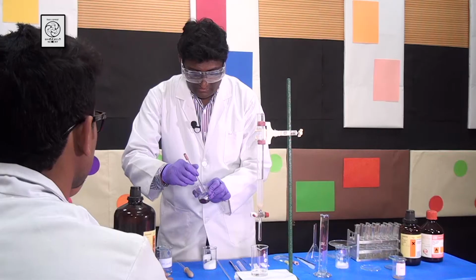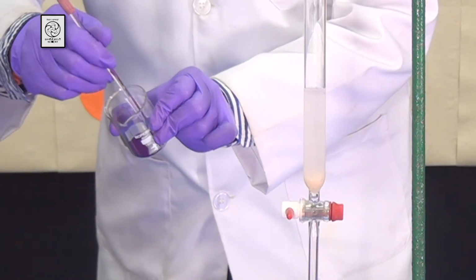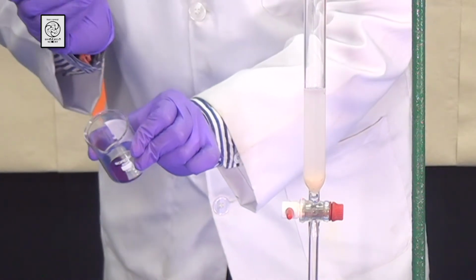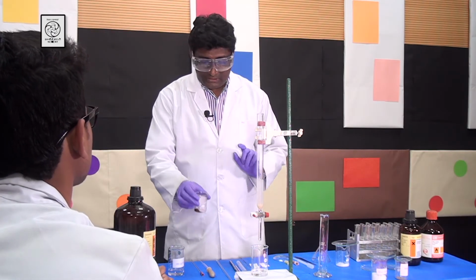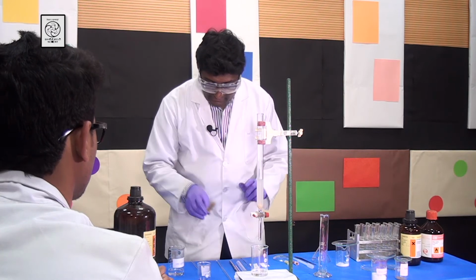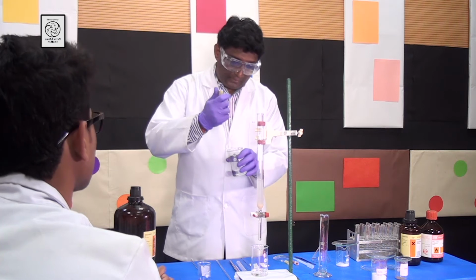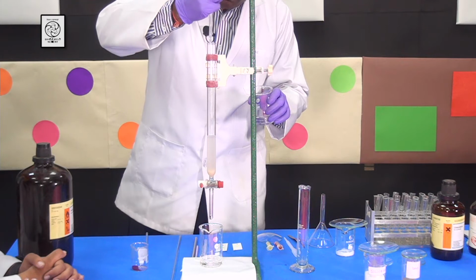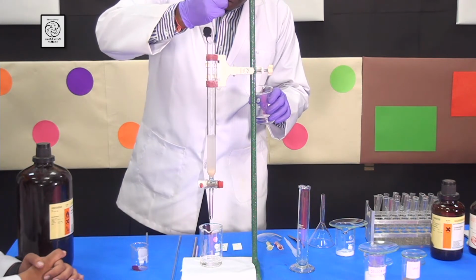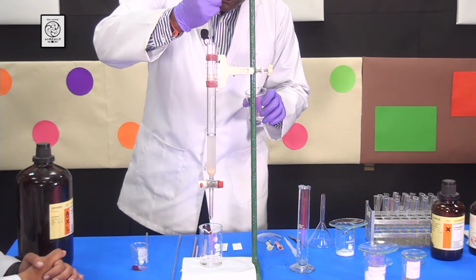Now students, you can see that after stirring it for 5 to 10 minutes, I got a very fine powder. Now I am going to load this compound onto the column. But before doing that, I am going to put some hexanes into the column using a pipette. Please be careful while you are pouring the hexanes into the column. Pour it uniformly so that it doesn't disturb the top layer.